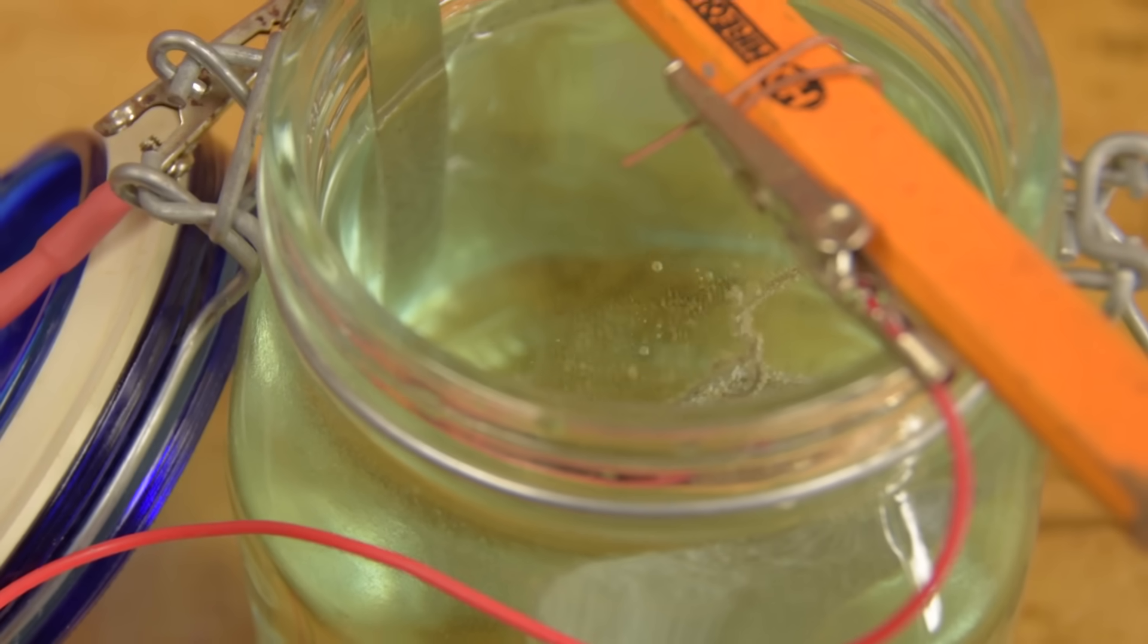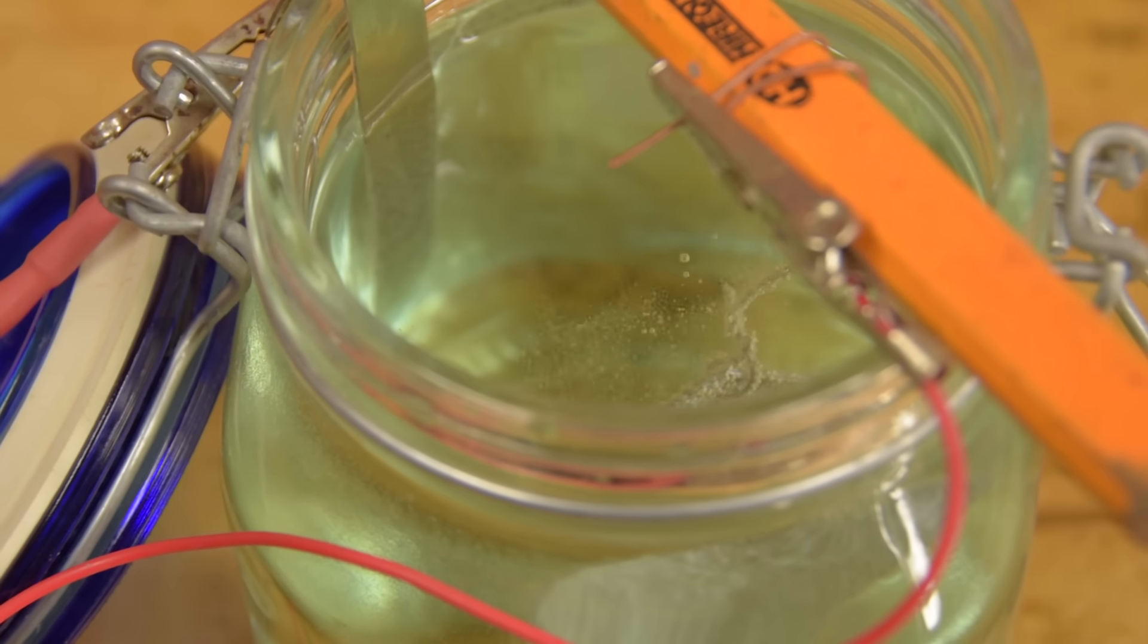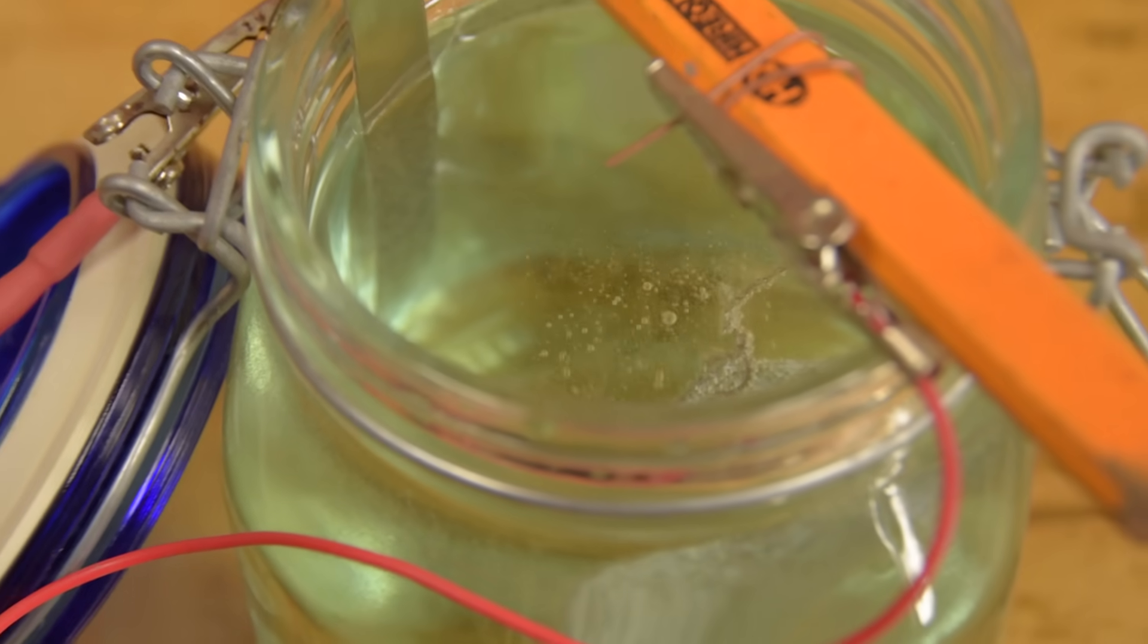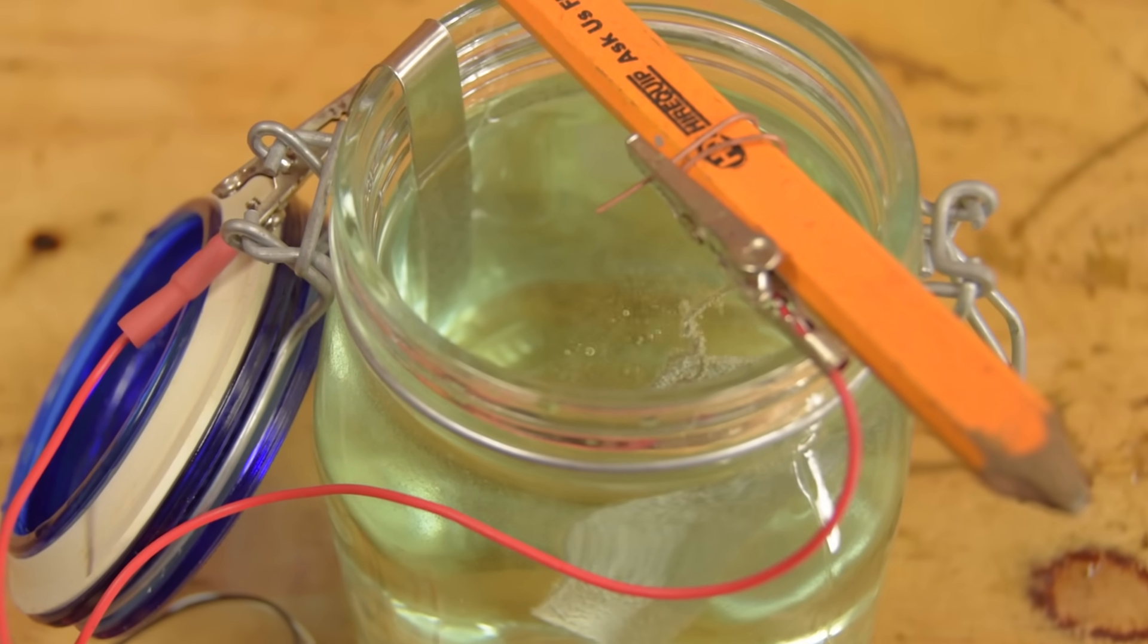If you're just messing around, plating stuff for fun, about 20 minutes should do it. Make sure to turn the part around a couple of times during the process, so that it plates evenly.